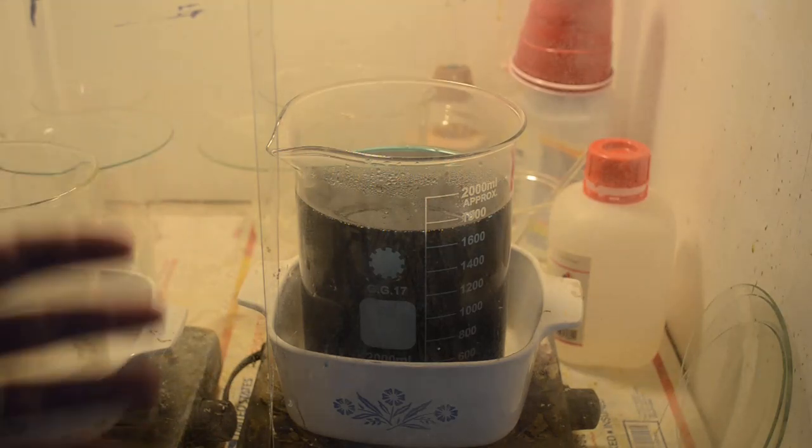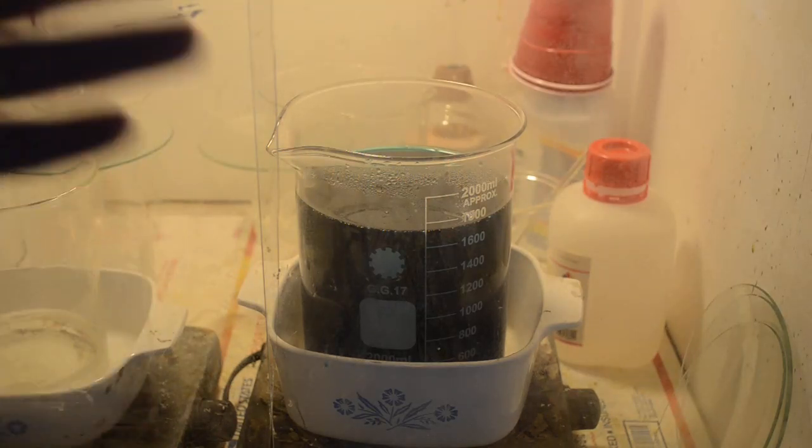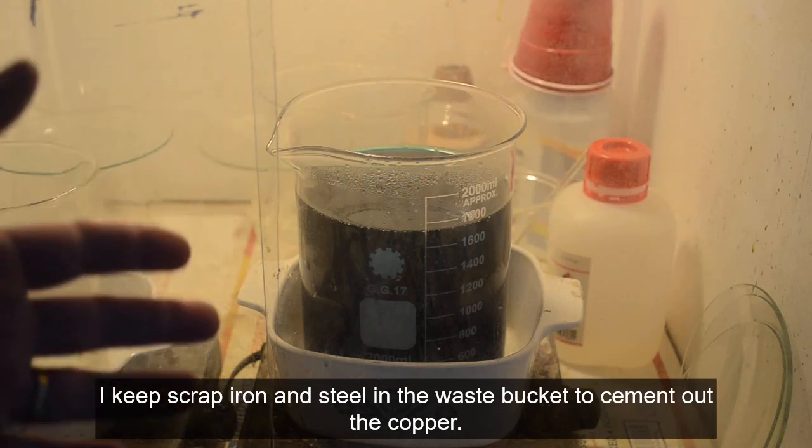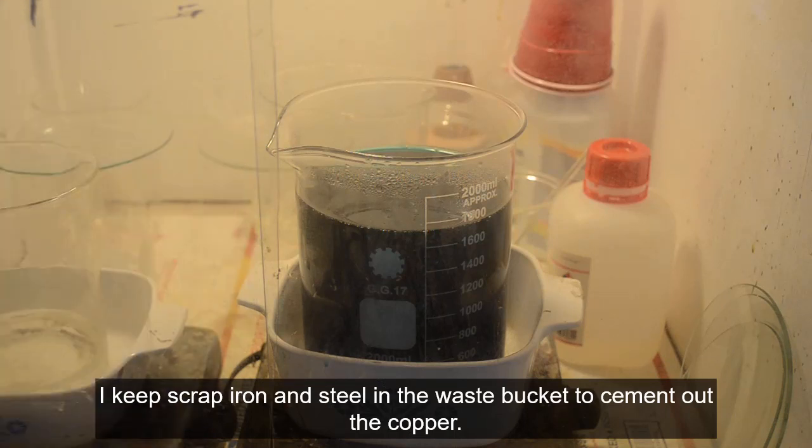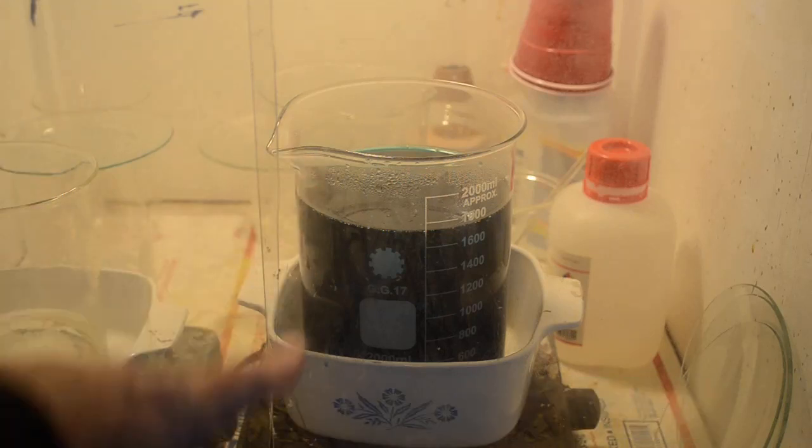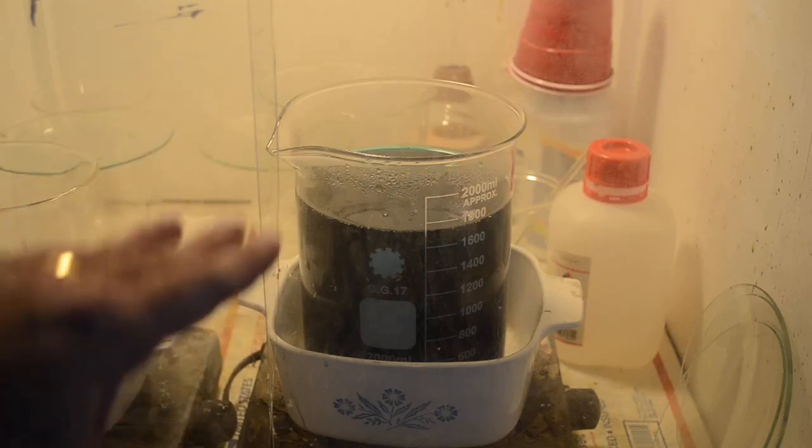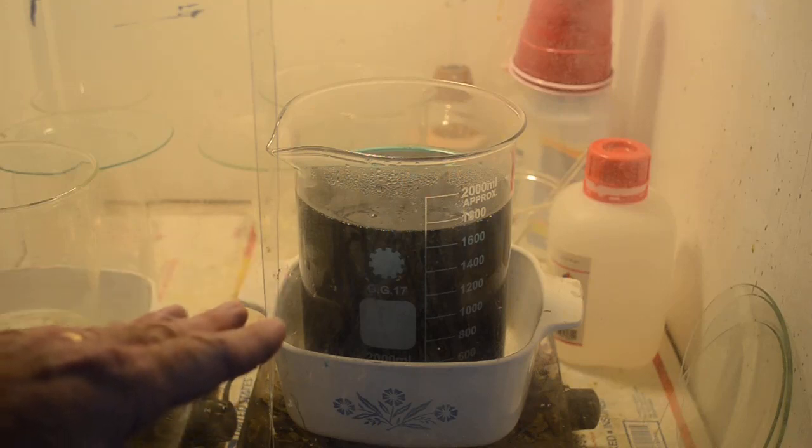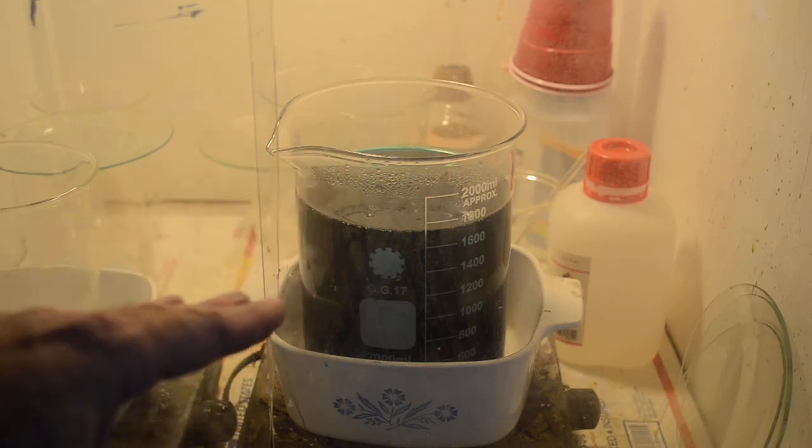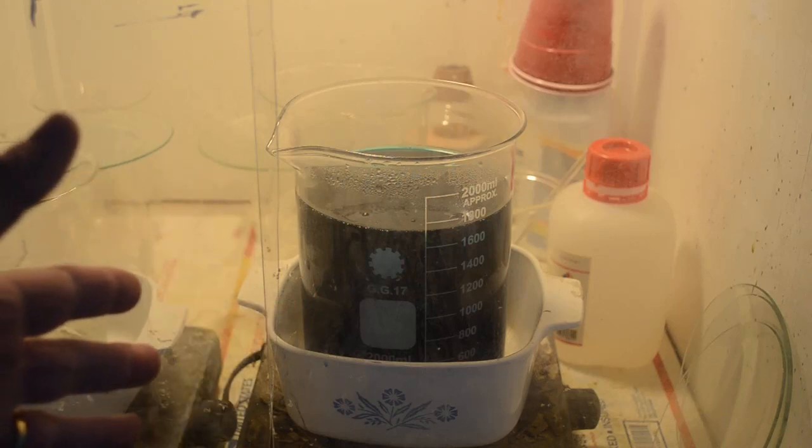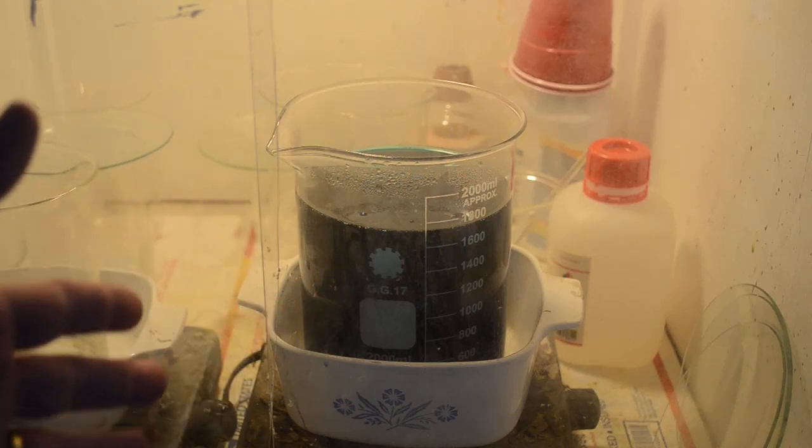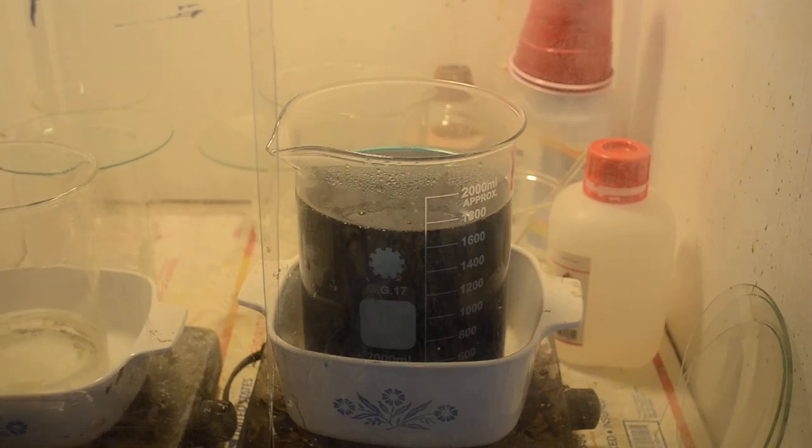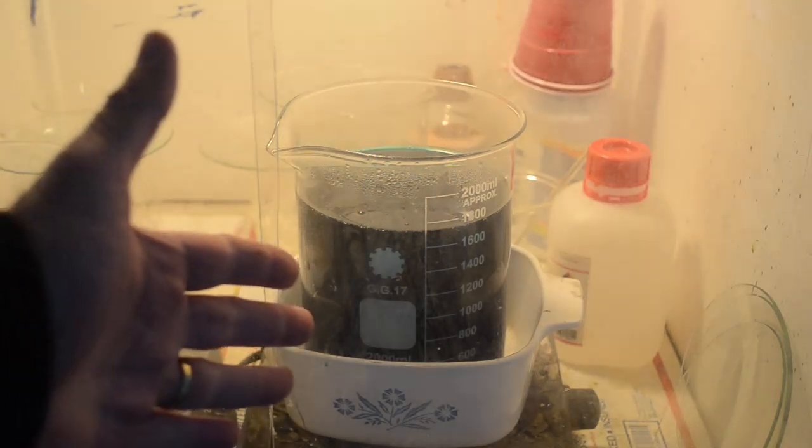I would put it in my waste bucket. It's mostly copper nitrate, ferric nitrate, and other nitrates in there. The iron would cement out the copper, but I'm going to try something different. I'm going to try evaporating this stuff down slowly and see if I can get the nitrate compounds to crystallize into solids, and I'll see if I can get some nitric acid back out of it by baking it in a retort and recover some of my expensive nitric acid.